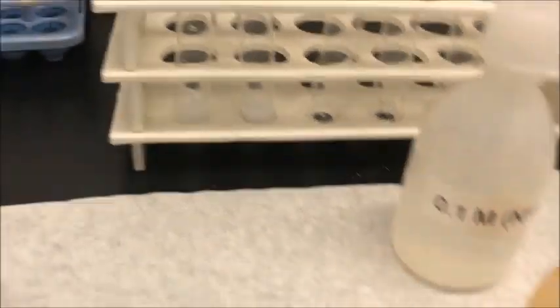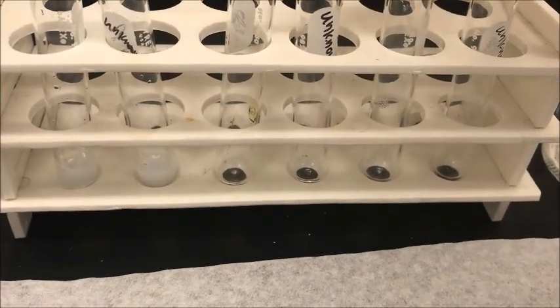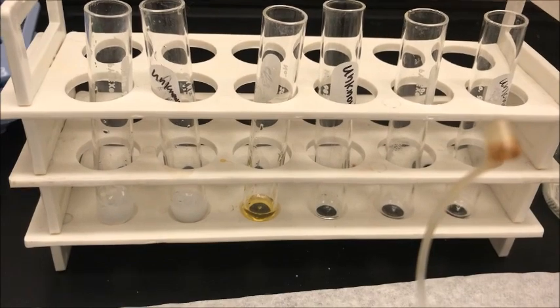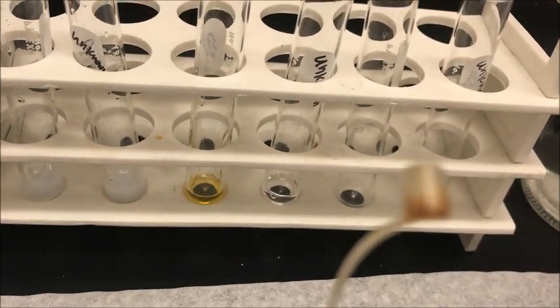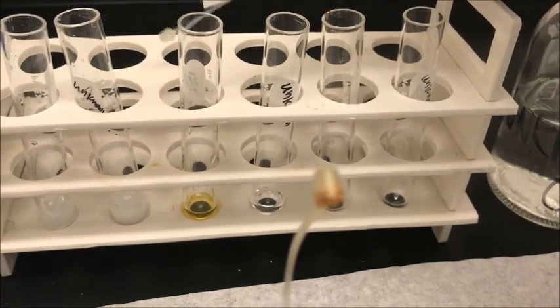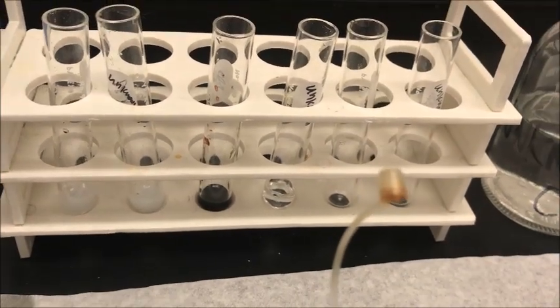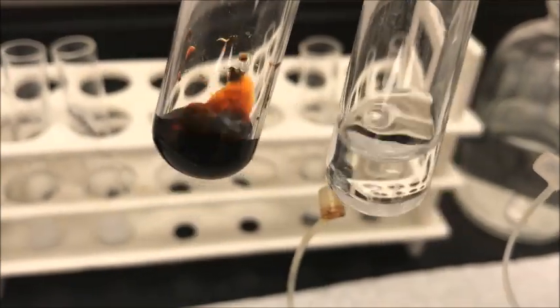Next, I test for iron. For that, I use ferric chloride solution — again 1 ml — and 1 ml of the unknown solution. Iron reacts with potassium thiocyanate and gives a red precipitate. My test solution contains iron, but my unknown does not have iron.